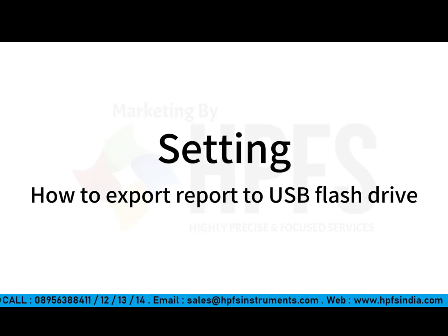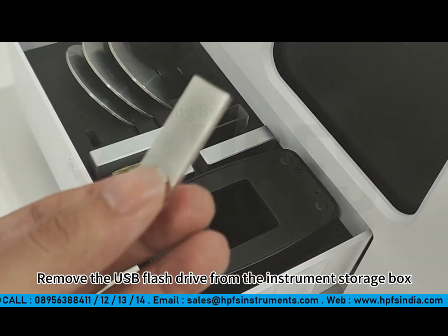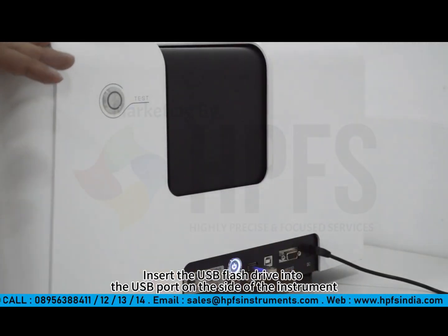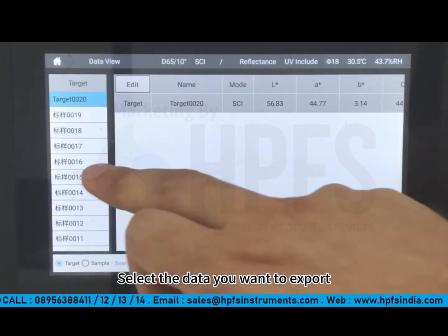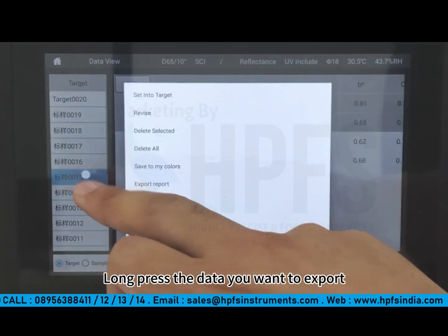Setting. How to export a report to a USB flash drive. Remove the USB flash drive from the instrument storage box. Insert the USB flash drive into the USB port on the side of the instrument. Click Data View. Select the data you want to export. Long press the data you want to export.